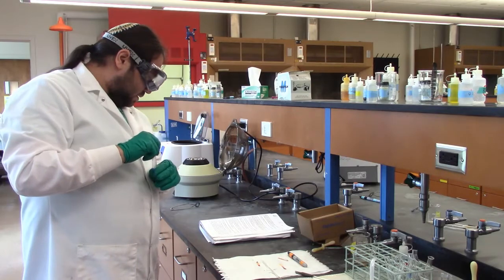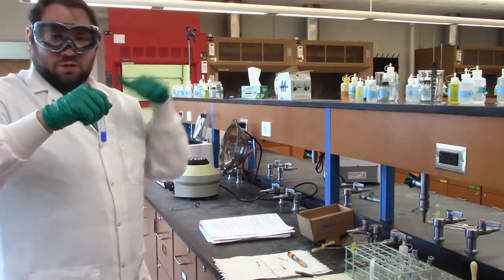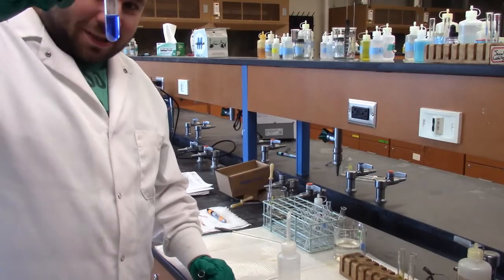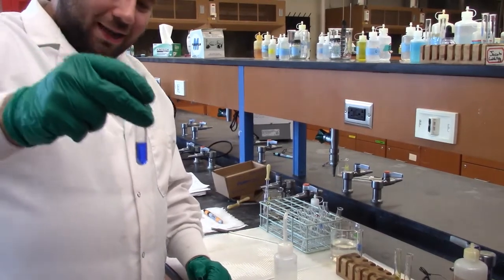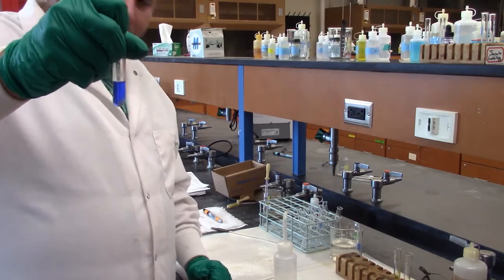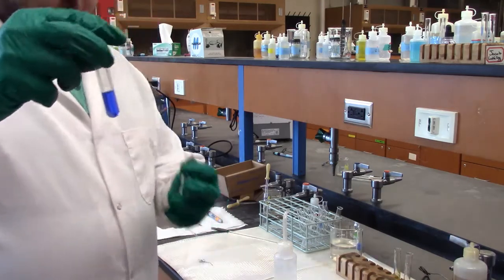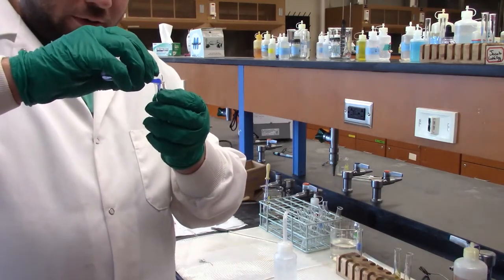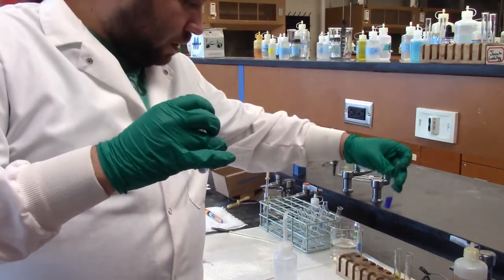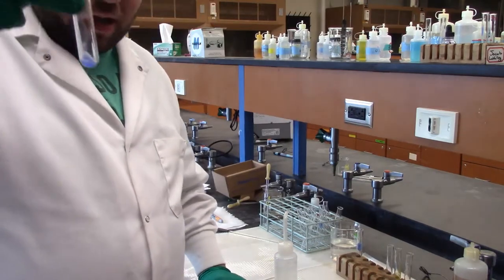Okay, so now I'm going to centrifuge this to get that bismuth that came out to settle to the bottom, so we can do some other stuff with that. Okay, so now that we've centrifuged it, you can see that really pretty blue color. I keep holding it too high for the camera, don't I? I apologize. And in the corner, we have this white powder that's probably our bismuth, but we're going to do the last test just to be sure. So I'll separate that out. So there's our copper. Not all of the copper came out, but who's perfect? Not me.